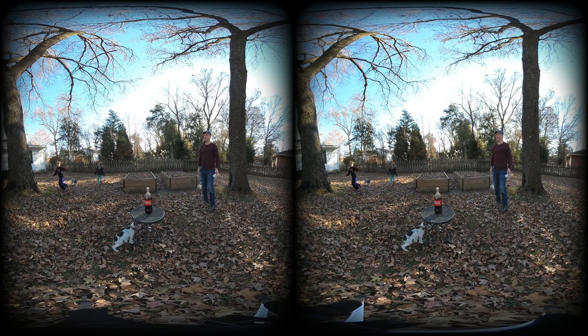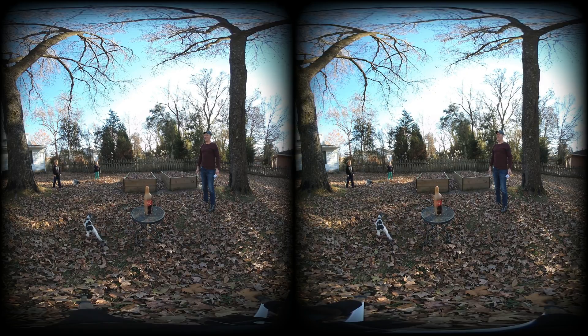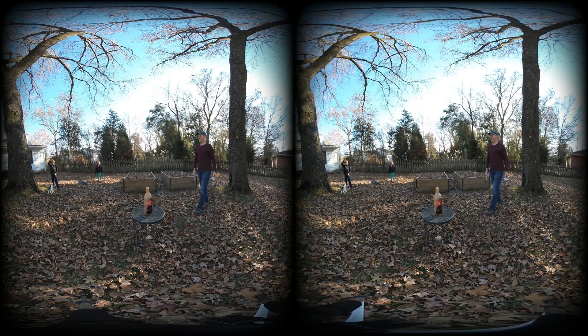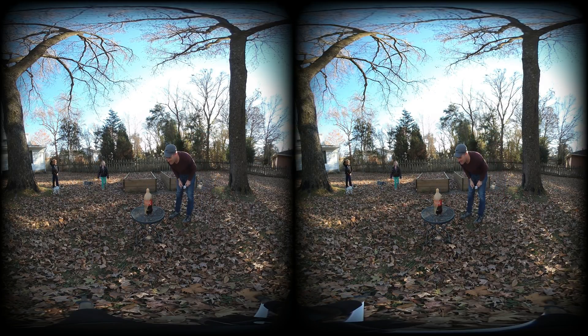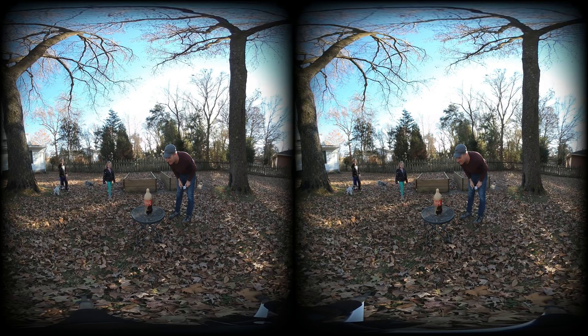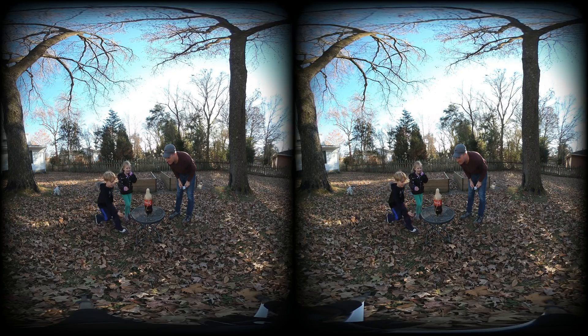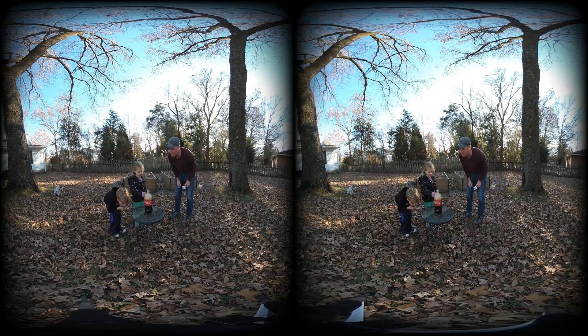Can we touch it? Yeah? Can we touch it? You can drink it. Oh, it's done.